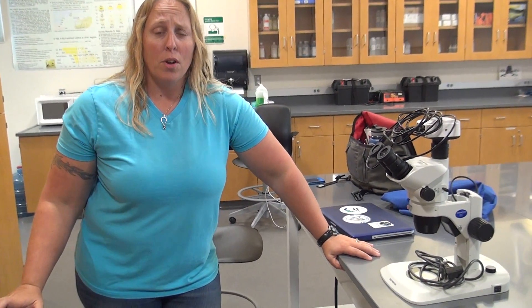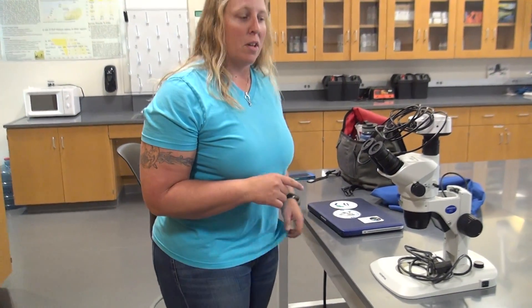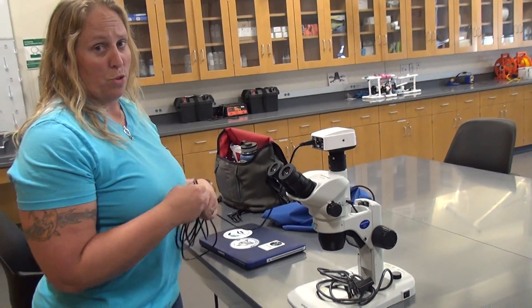Hey, my name is Dorothy, and I'm going to show you how to use the microscope that has the attached camera on top. It seems simple, and it really is. Don't break it, because if you break it, you buy it, and it's probably more than your whole year's tuition.